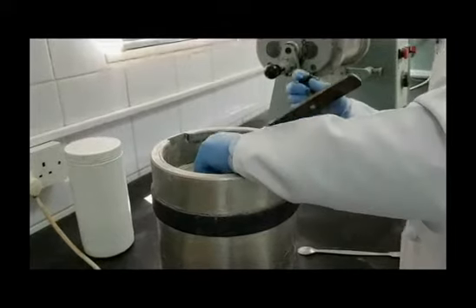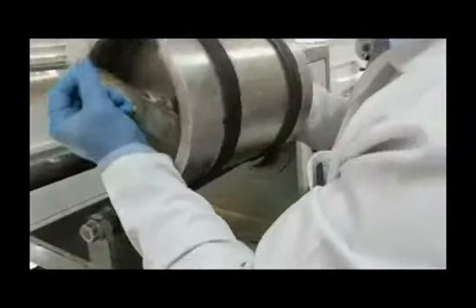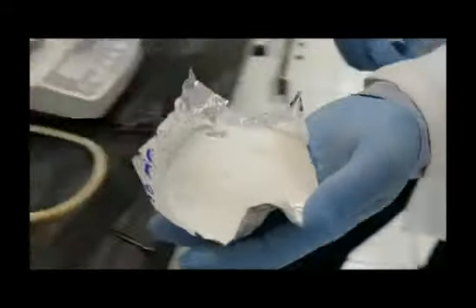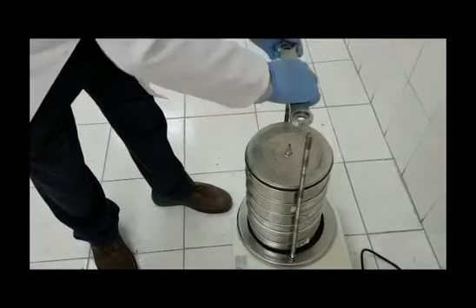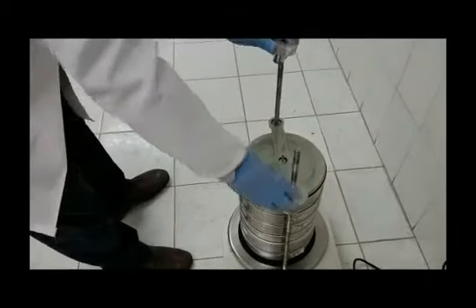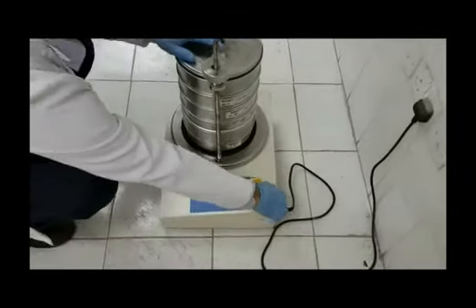Now, close the milling chamber tightly, place it on the rollers, and continue milling for the other scheduled times at the same speed. Here, we will rotate the miller for another 10 minutes to get the 20-minute sample. Place this sample at the top sieve of those arranged according to their pore sizes and, with the lid in position, clamp the sieves to the sieve shaker and agitate for 10 minutes using the pre-set parameters.